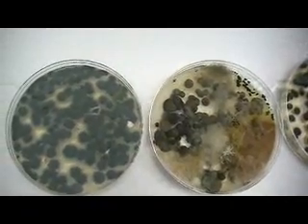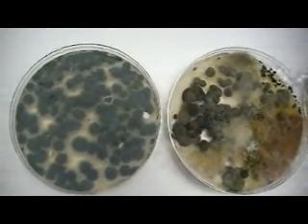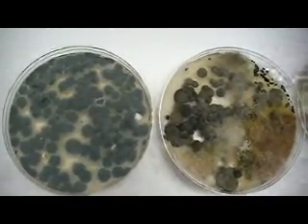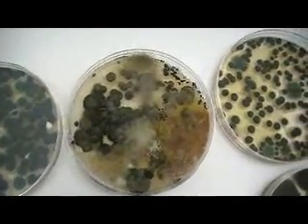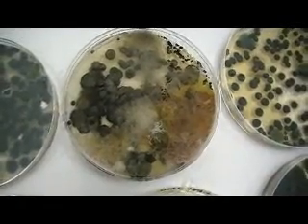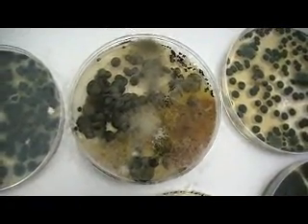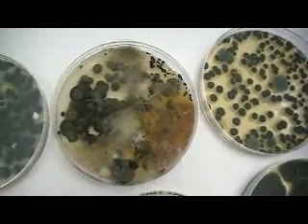If we can go closer and look at how they look like, you can see that we have these ones. The first plate there shows bluish mould, then the second plate there shows some which appear to be white, others are reddish, we have greyish and even blackish.